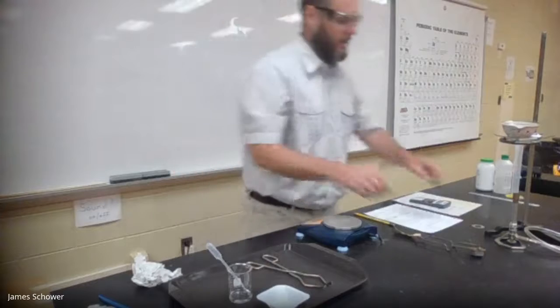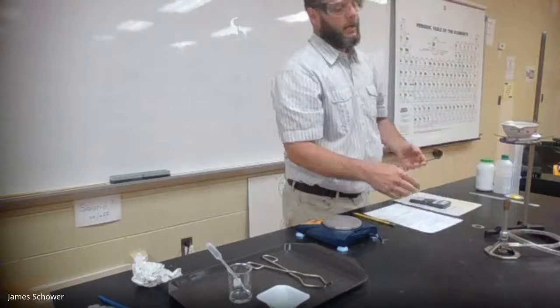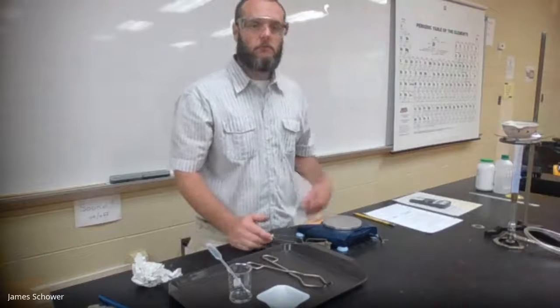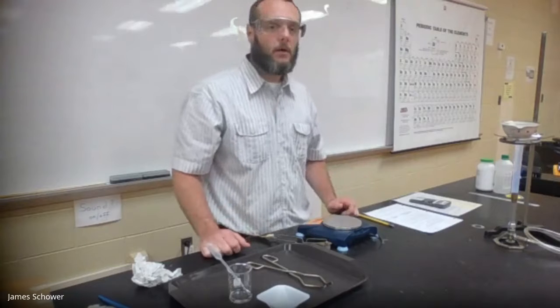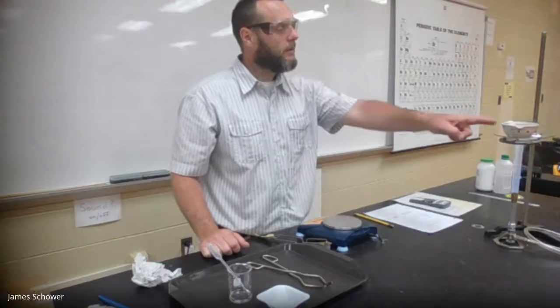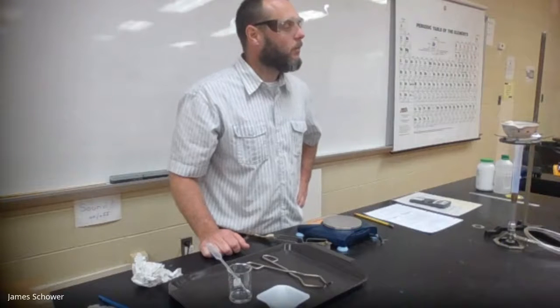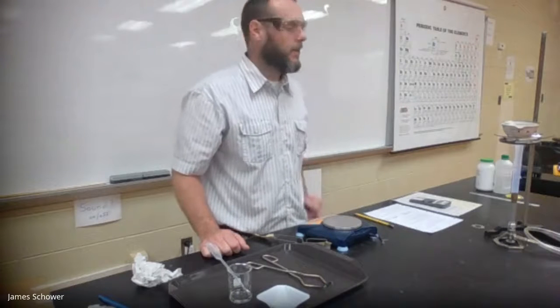Now we're going to begin heating it with the Bunsen burner. I'm going to slide the Bunsen burner under and let it begin to heat up. How do you know when you're done? Well, there'll be no more steam being produced. Steam is the evidence of water evaporating. As it gets hot, you're going to see a little opening there, steam come out. We'll let it go for a couple minutes until the water is evaporated and it is completely dry inside.